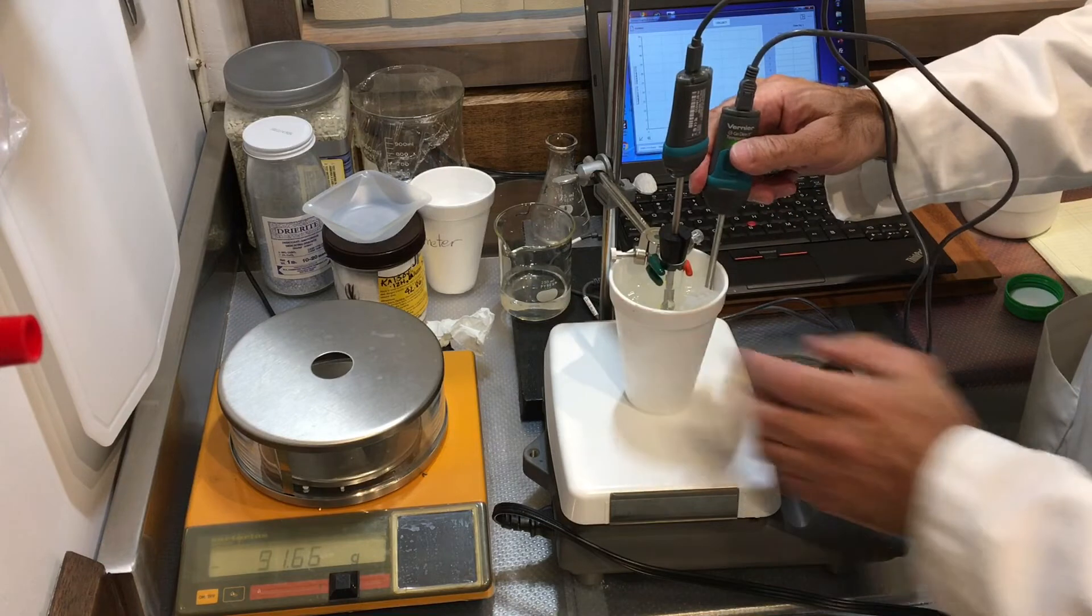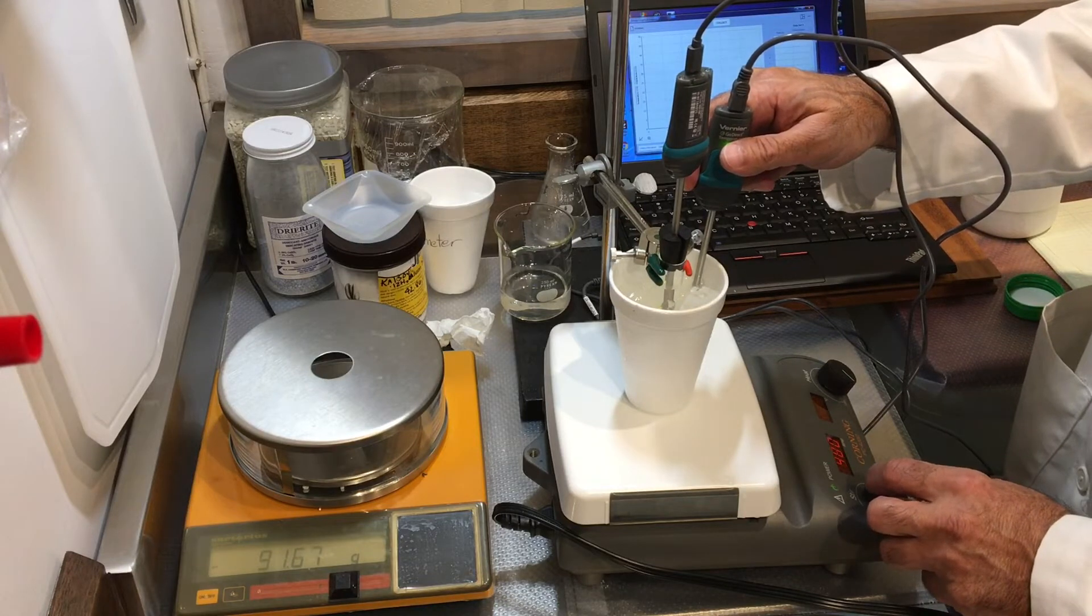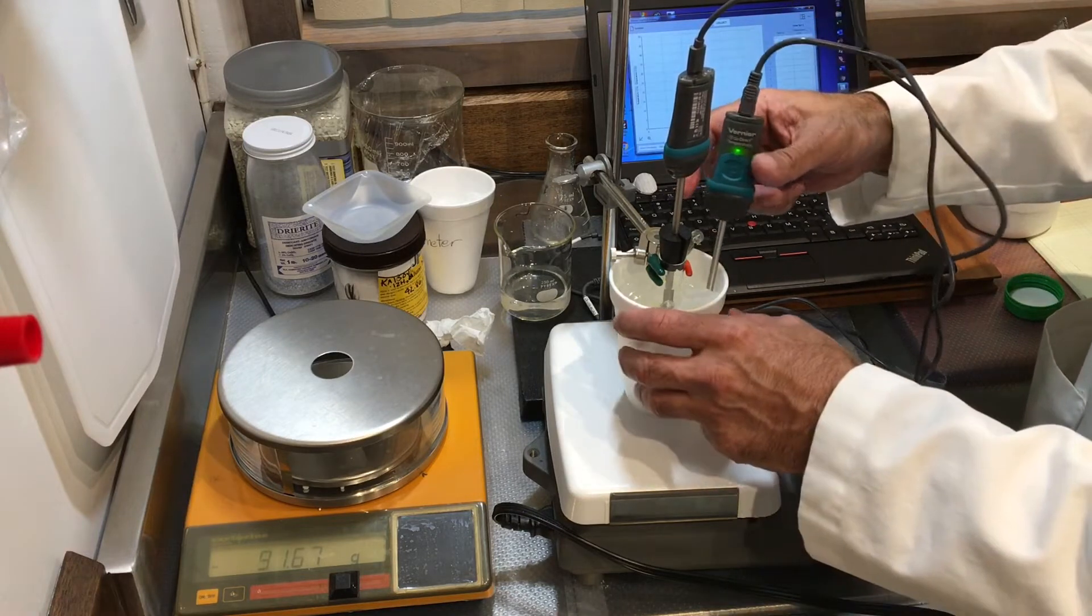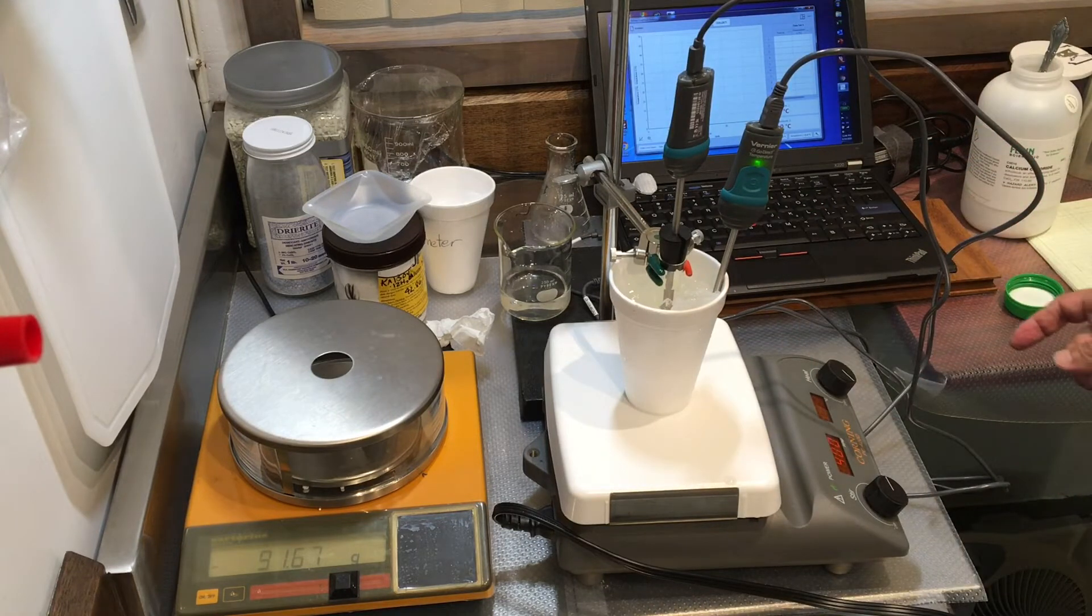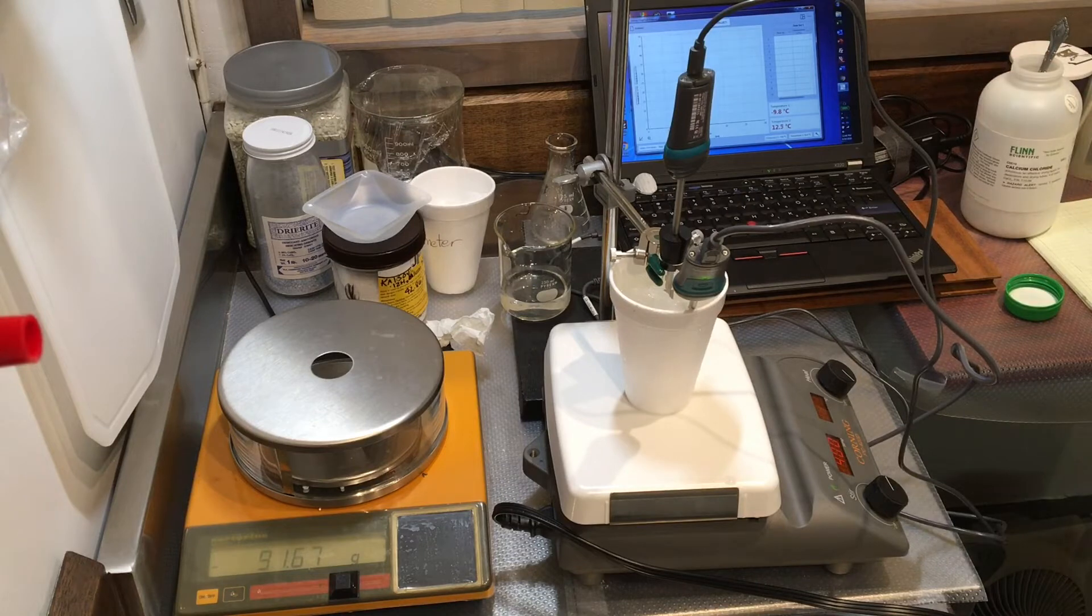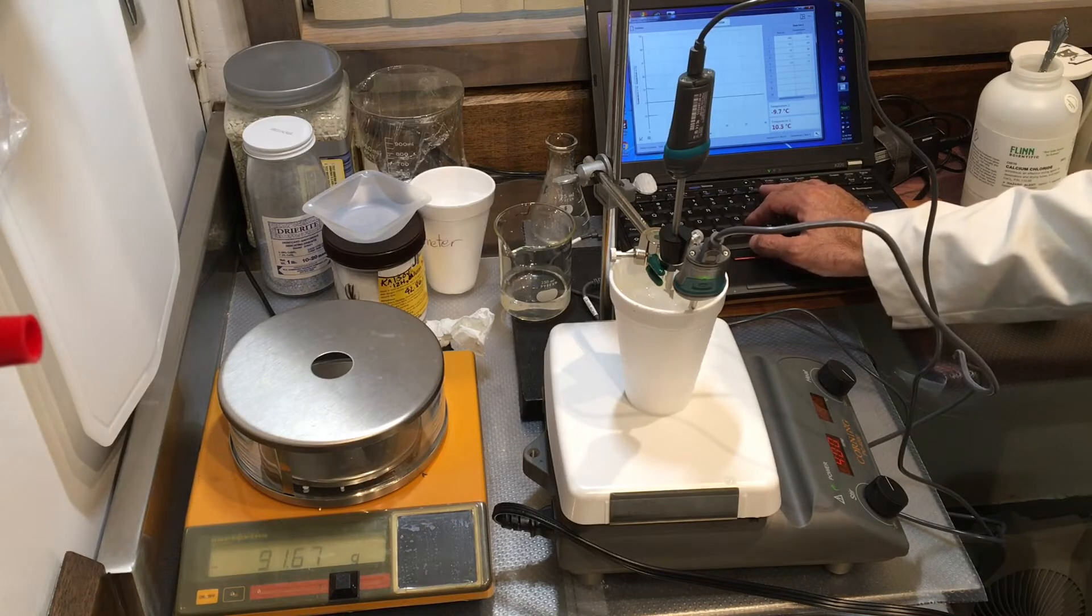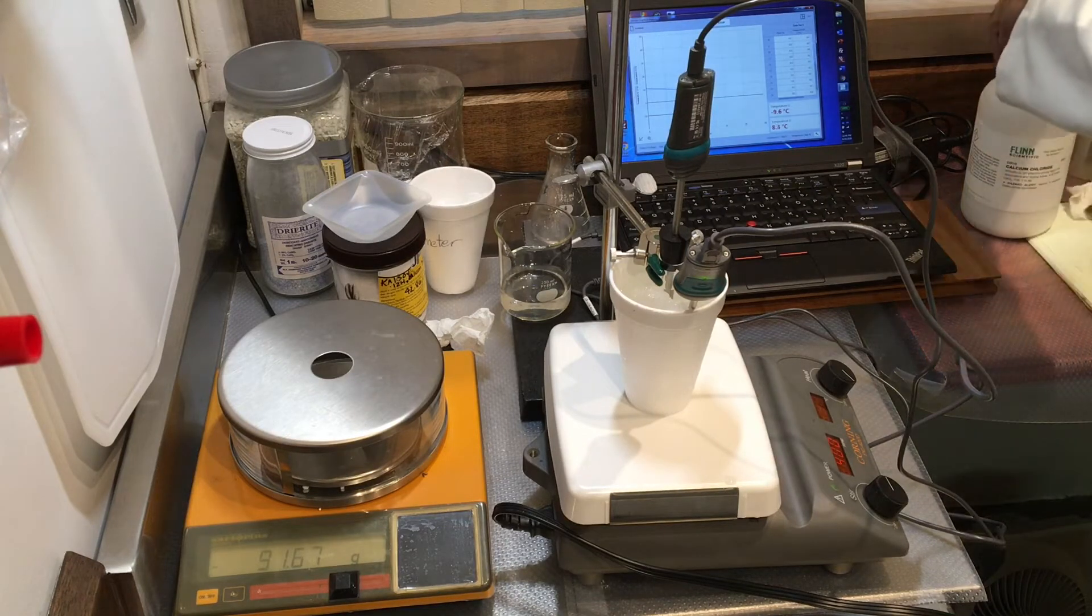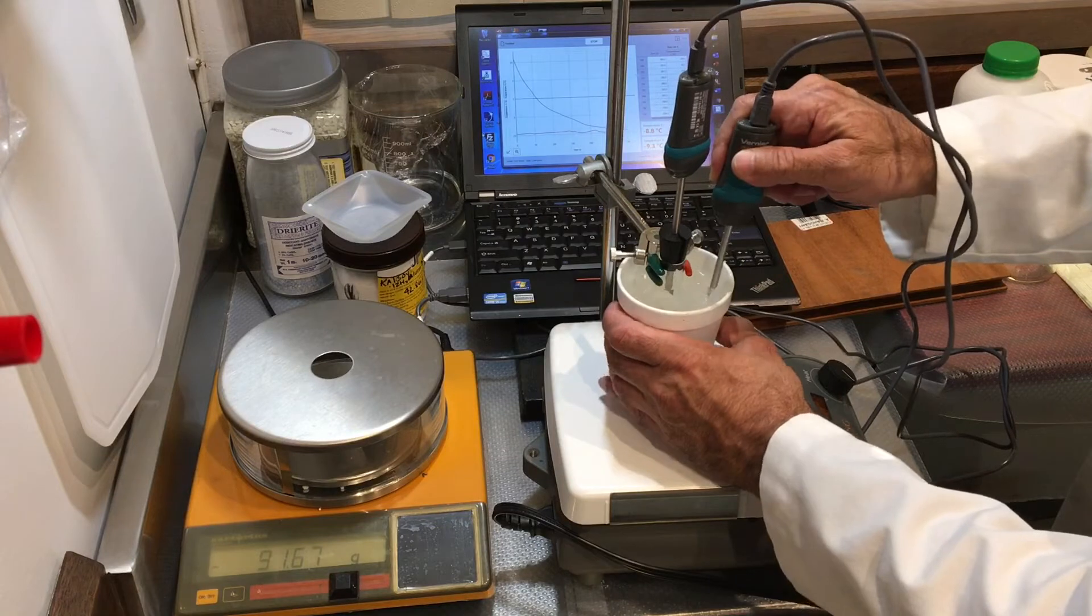My second probe goes in. Probe is good. Magnetic stirrer is going. I'm roughly turning like around 500, 400, 500 revolutions per minute. It should be good enough. And it's cooling down, as you can see, and as I'm blocking you. Let's go ahead and get this away from you. And I'm going to collect this time I remembered. Let's go ahead and collect our temperature, and see what we have. My bath is not too well.